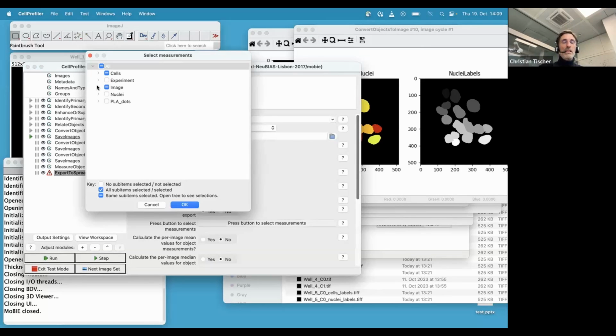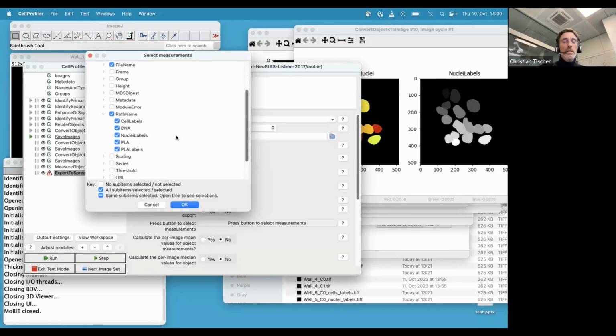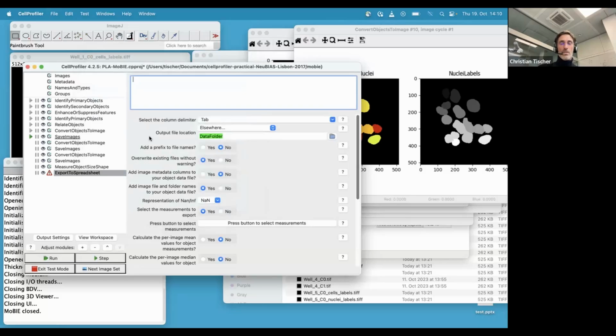So first of all, MoBIE later needs to know, obviously, where are all these images. So you have to save the file names of all the images, and also the path names. And we need to know where the cells that you segmented are in the image. So for this, you can either in area shape measure the center of the cell, or you can also save here this location, which actually give you the same. So both would work. So, okay, good. So this is all you have to do in CellProfiler. And then you would just run it.